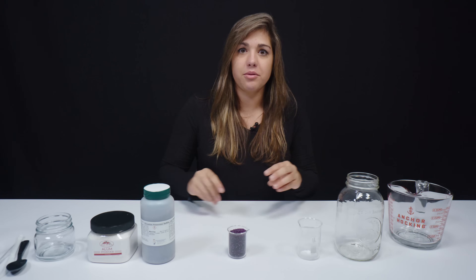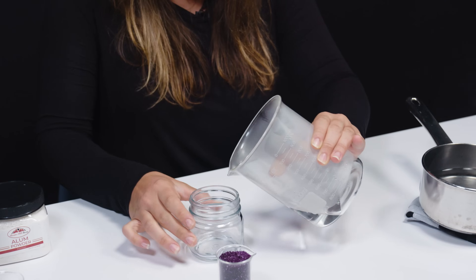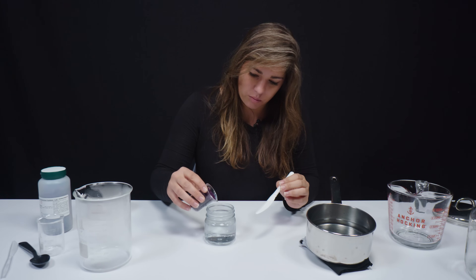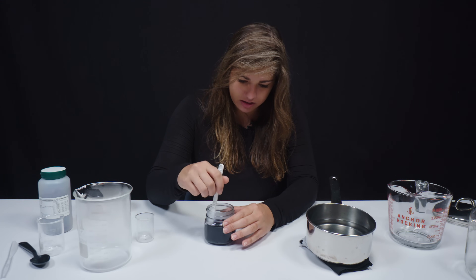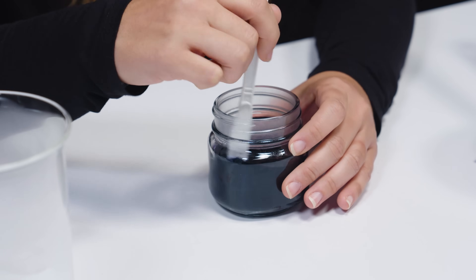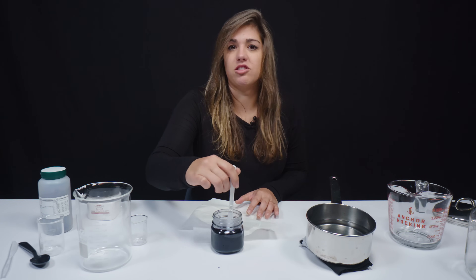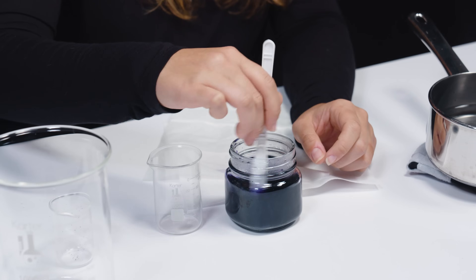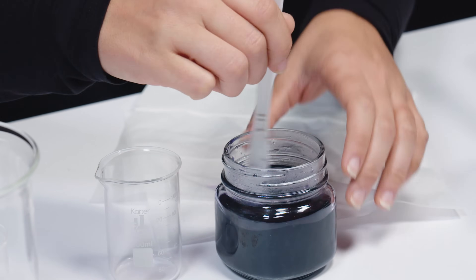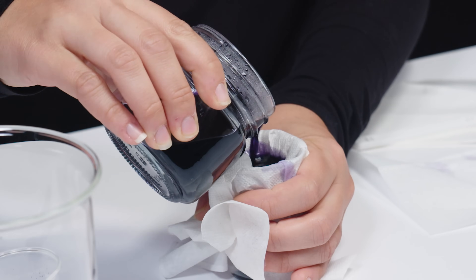So we're going to walk you guys through how to do this. We got our steamy water — you don't boil it, you just get it really hot. We've got 100 milliliters of water and we're going to add 60 grams of chrome alum, and now the stirring begins. I want it all to dissolve. Oh, it's like blue — I had read that it was a different color but I had never seen it. This is actually used in leather tanning, and it's not going to outright hurt you but you really don't want to leave it on your skin. I'm actually going to filter this because I don't think I'm going to get all of these little chunks out, and I don't want them in my final solution. So we're going to put a paper towel over this to filter out the bigger chunks.